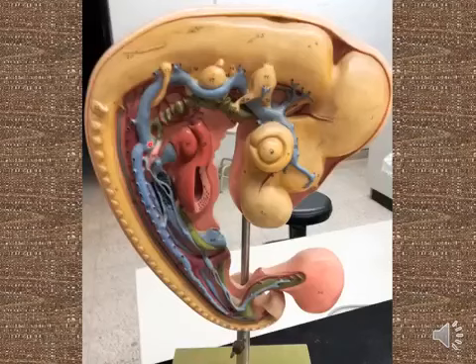From sinus venosus, the common cardinal vein divided anterior cardinal vein, posterior cardinal vein. This is the umbilical vein, and this is the vitelline vein. Dorsal aorta, common iliac artery, and this is the umbilical artery, and these the vitelline artery.